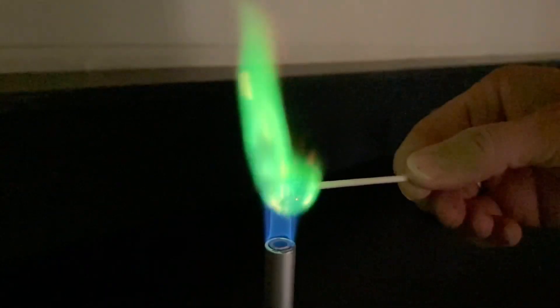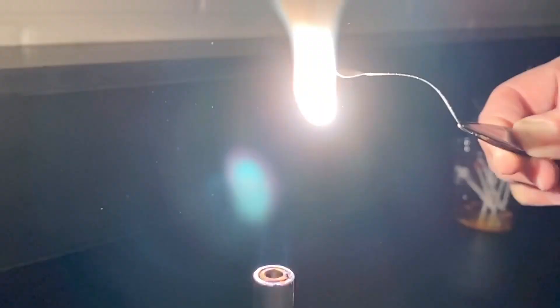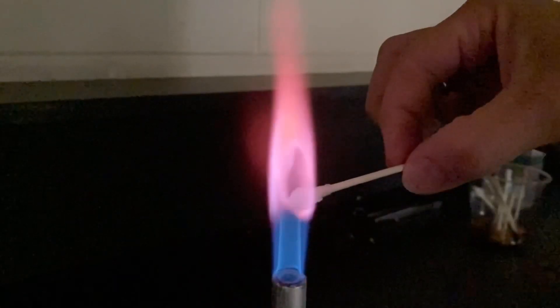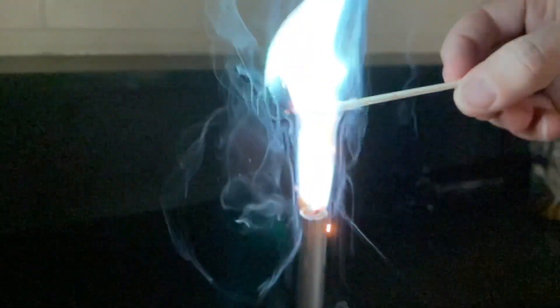Hey everybody, hope you're having a good day. Mr. Haimes here. Today we are doing a flame test challenge and we need your help. Let's get started.